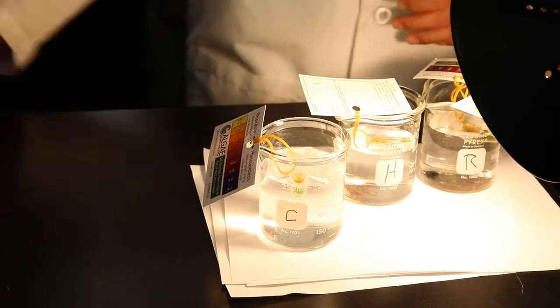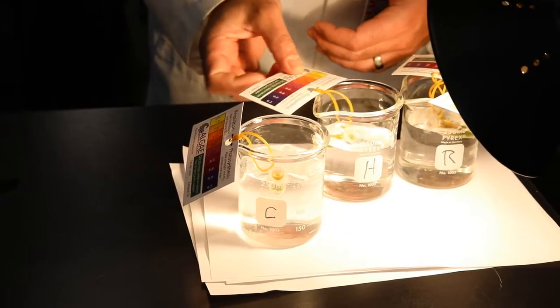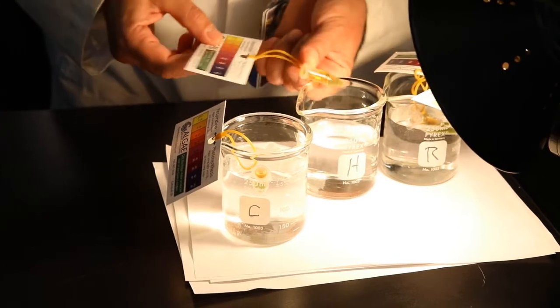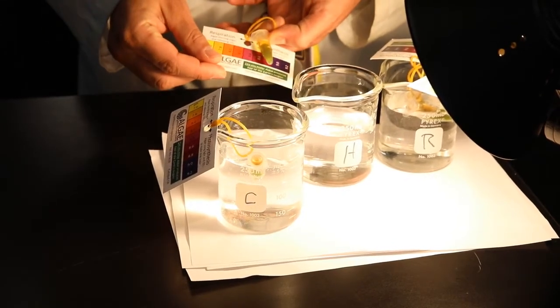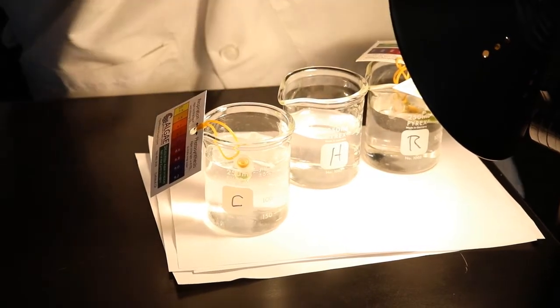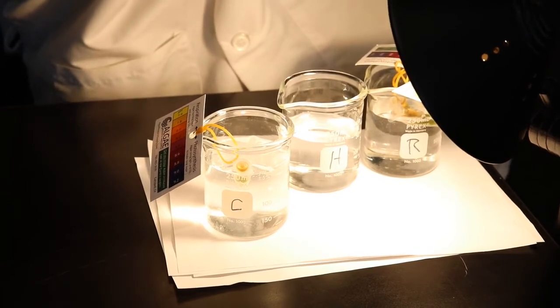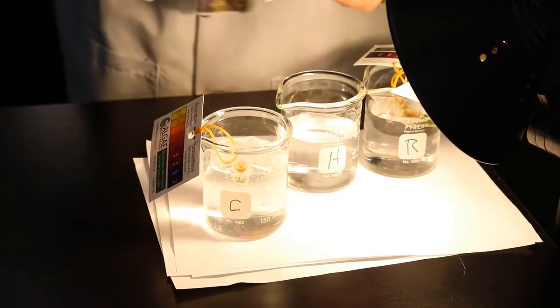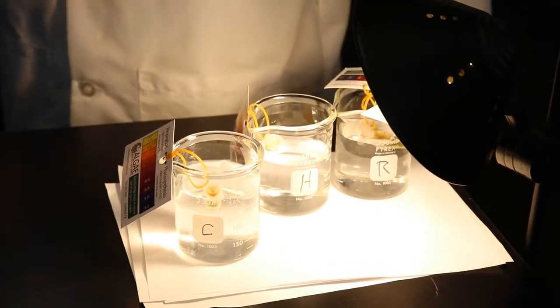Excellent job. A+. So, number 2, our hot water. If we look at that, that is about a, I don't know, Mr. Hilke, what do you say about that one? I'd put it 7.4. Or has it got more color than that? Yeah, 7.4 sounds good. 7.4 for number 2. Perfect.